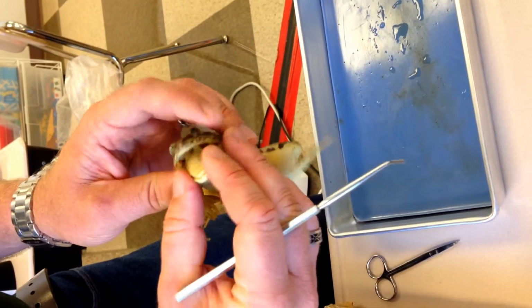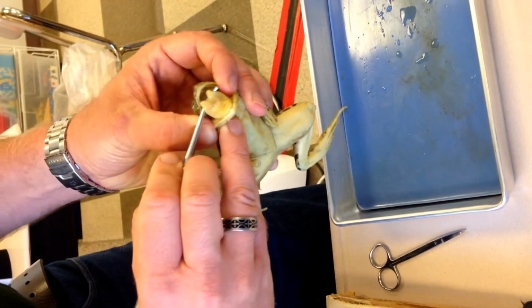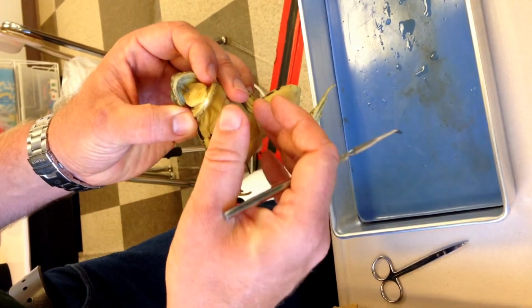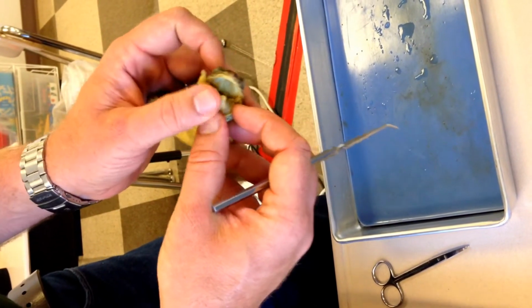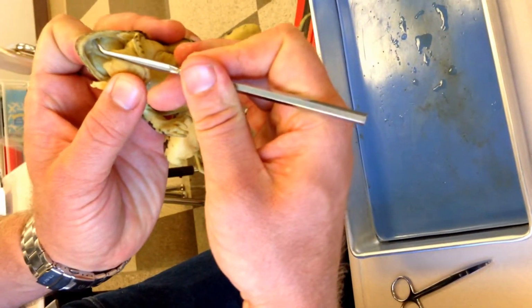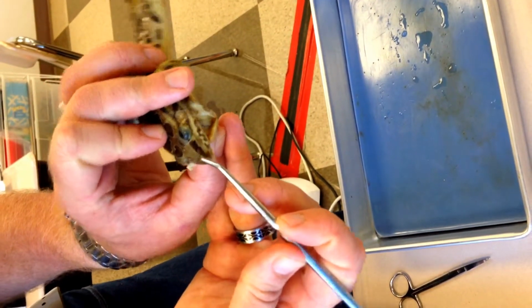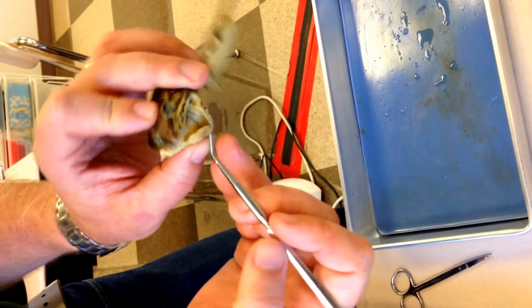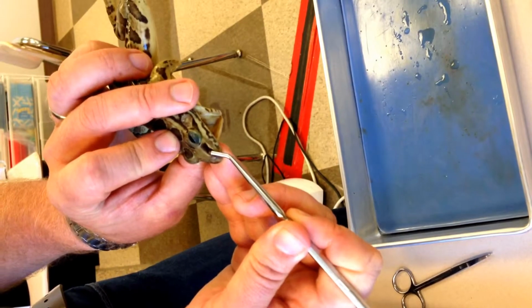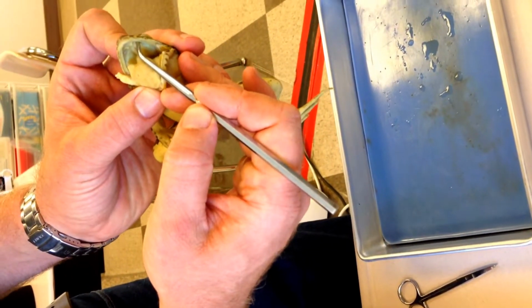Number three, when we open its mouth, it's going to be easy. It's this fleshy organ right here. Number four, inside the mouth, there's a hole that comes through the top. This is the internal, and this is the external what? Number four, I'm looking for a word. There's an external and an internal of this.